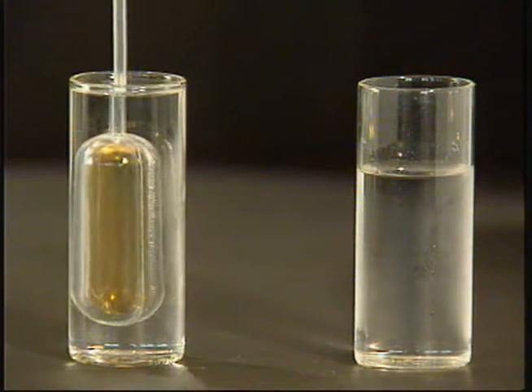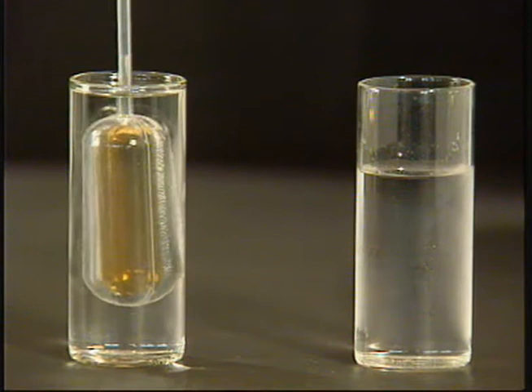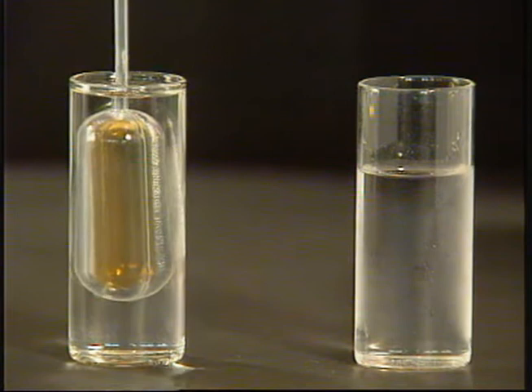In this experiment, brown nitrogen dioxide is produced and collected in a propette. Immerse the bulb of the propette in the hot water for about 15 to 30 seconds. Note that the gas in the bulb of the propette is dark brown in colour.